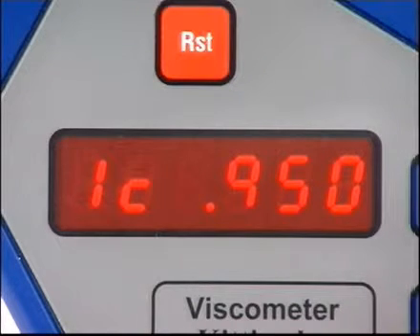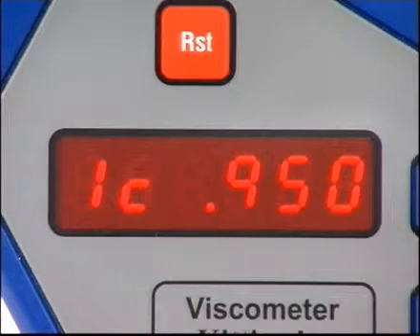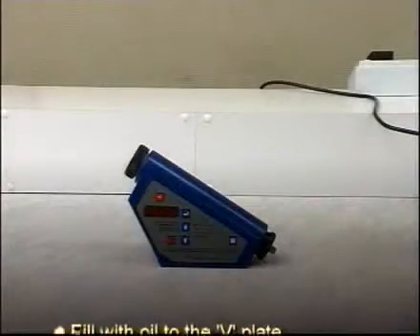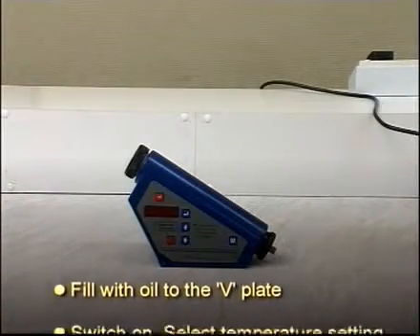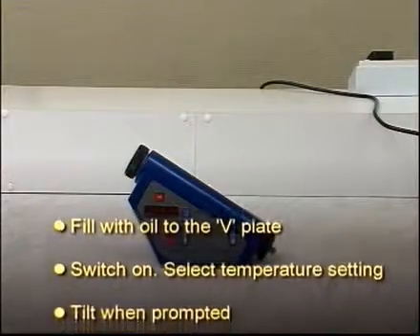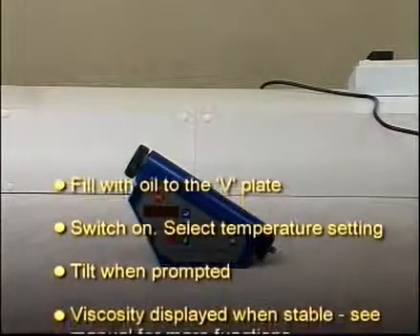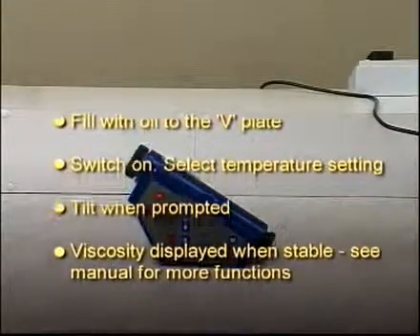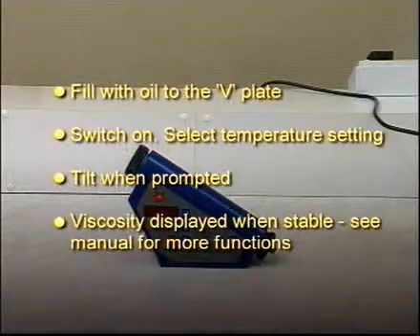This value will then be used by the viscometer for all the other calculations. To summarize: fill with oil to the V-plate, switch on, select temperature setting, tilt when prompted, viscosity displayed when stable. See your manual for more functions.